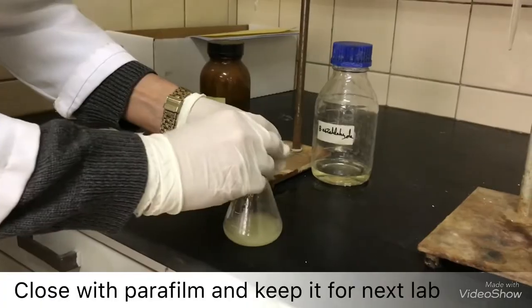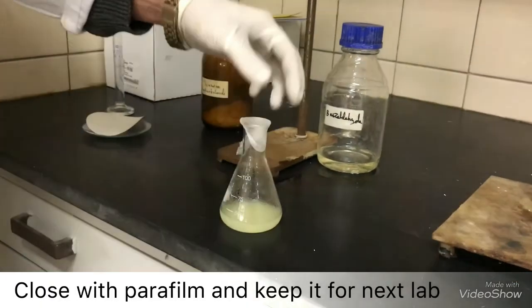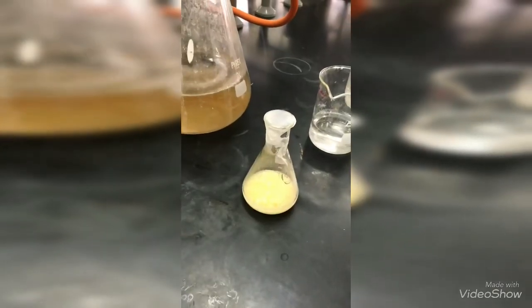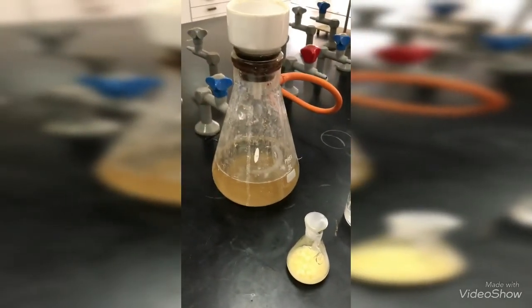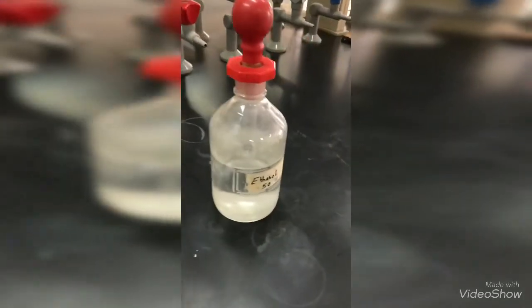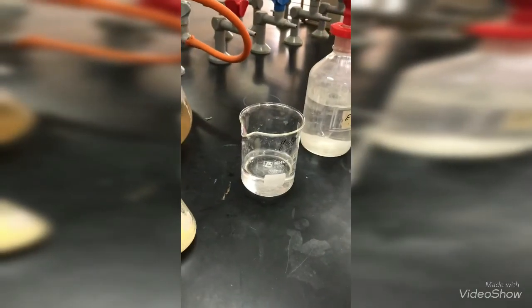Now close the flask using parafilm and allow it to stand at room temperature at least overnight. Now we will collect the crystals using a Buchner funnel and then start washing them with 7 ml of 50% ethanol and several portions of water.